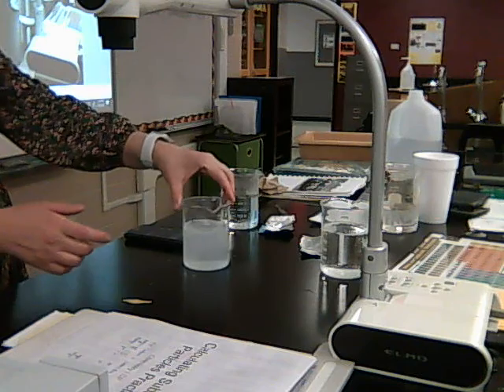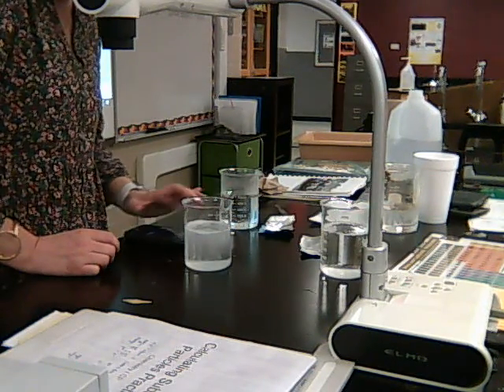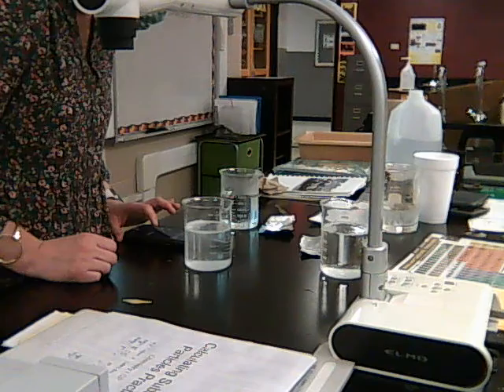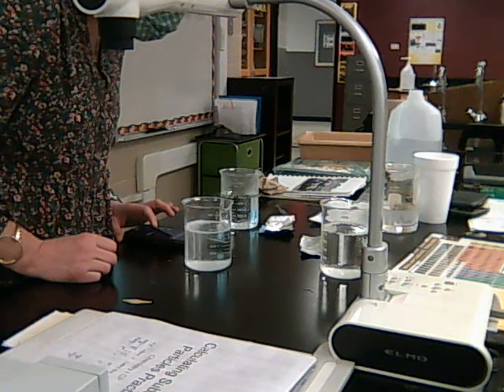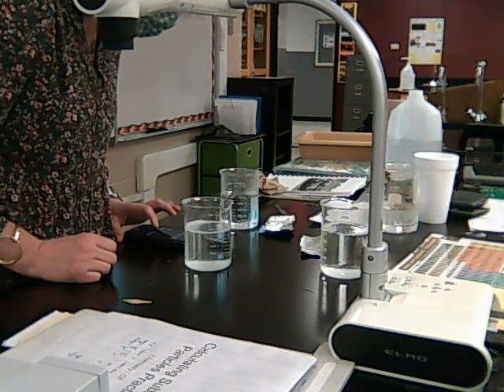Okay, the tablet's at the top. We can see it right up here at the top. Almost gone. Or there's 2 pieces actually, because it was cut in half. So I have to wait till both halves are bubbled away. Almost gone.